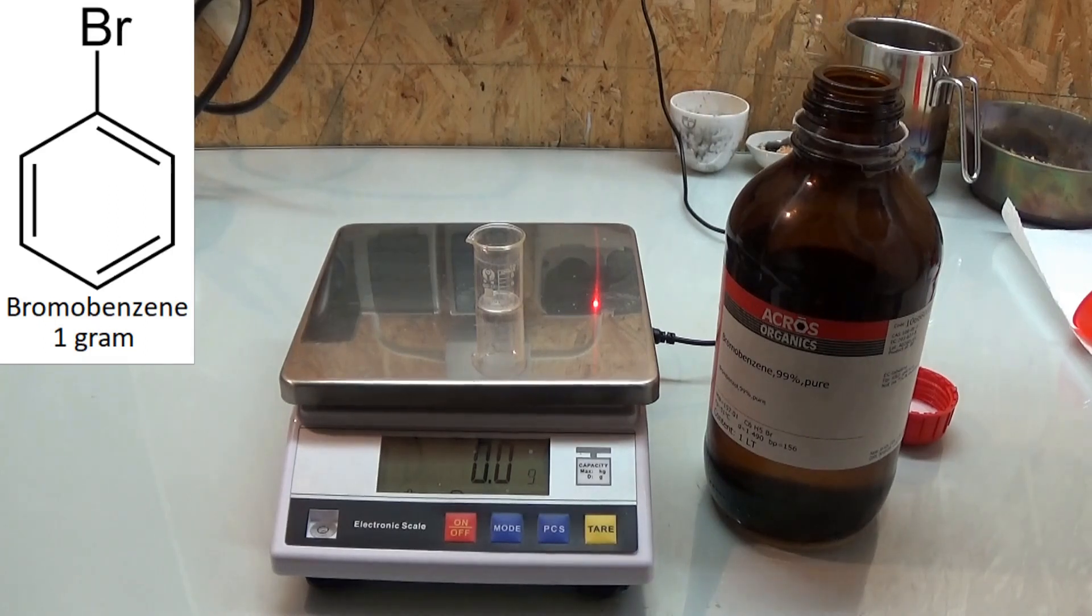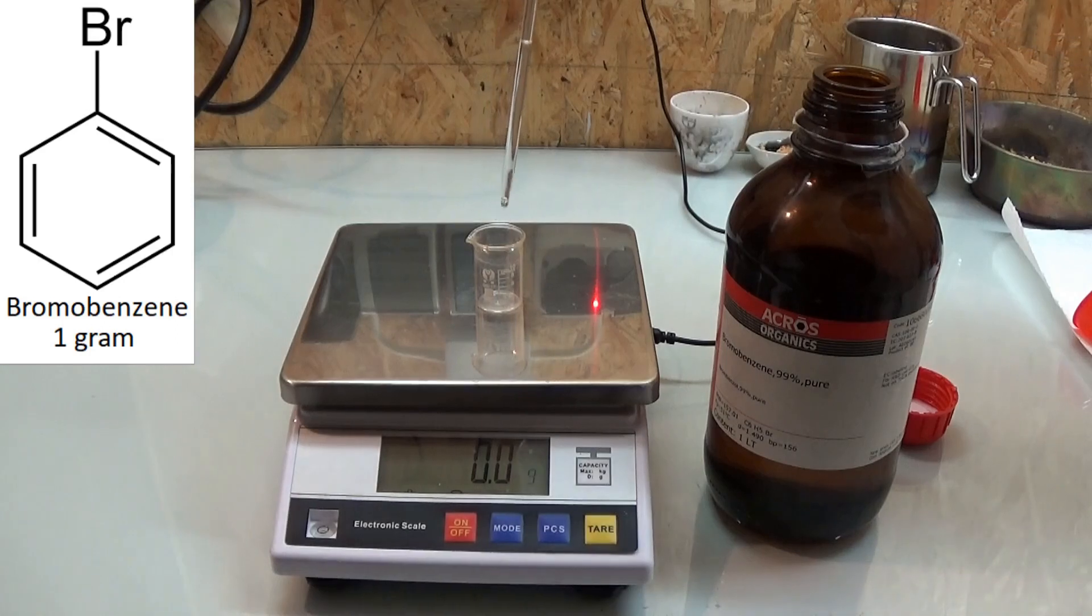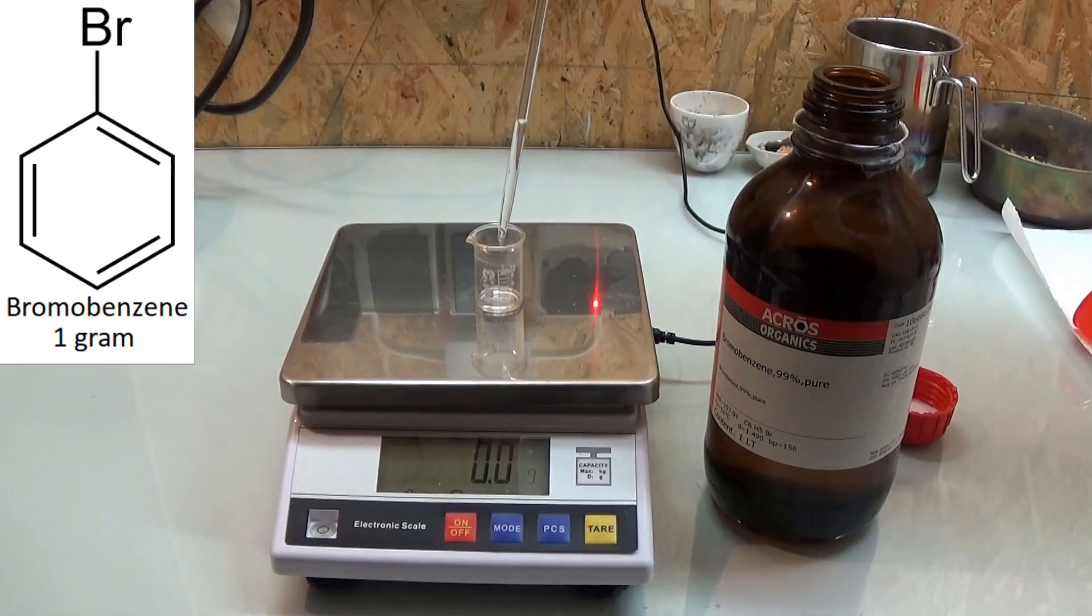It should be noted that although bromobenzene is not very toxic, you're still handling a halogenated aromatic hydrocarbon so working with protective equipment is a must.